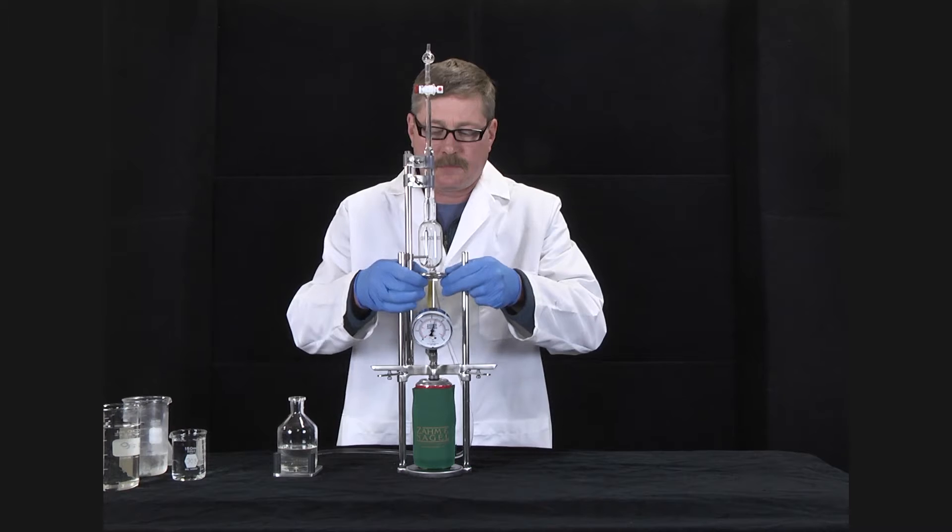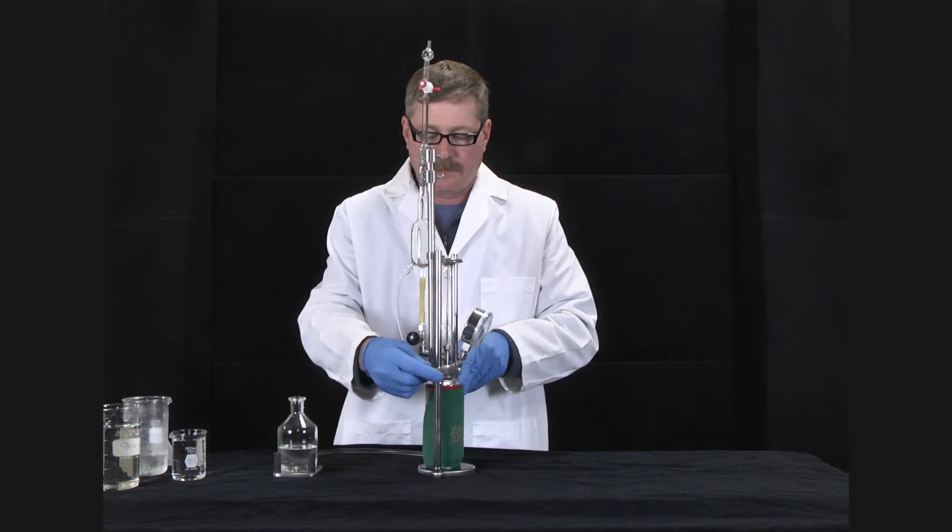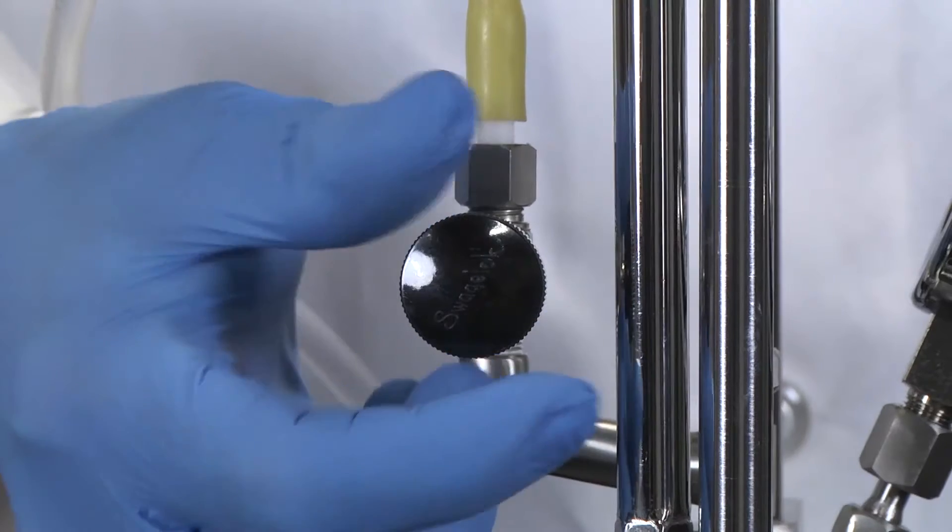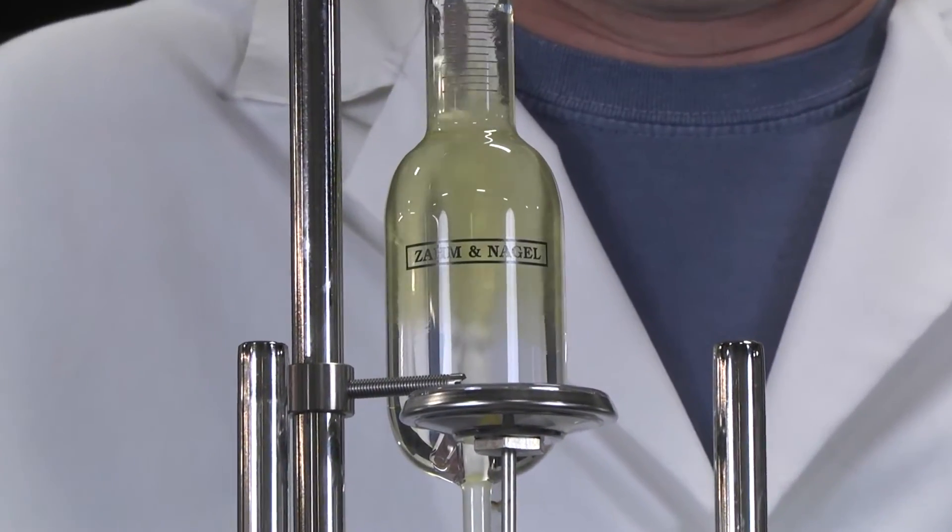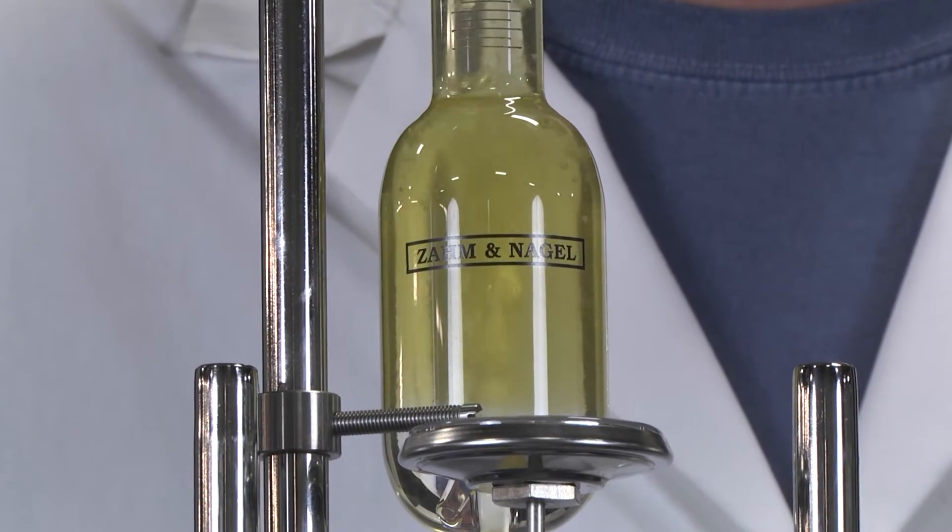Withdraw the dial thermometer to the thermometer stop. To perform the air test, open the whitey valve and allow gas to flow into the burette, reducing the gauge pressure to 5 psi or less.